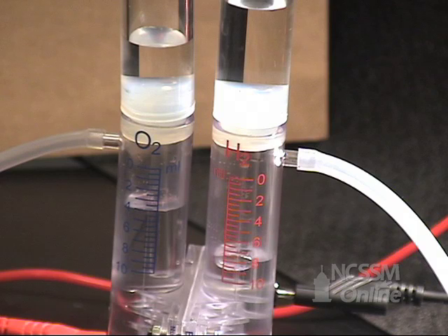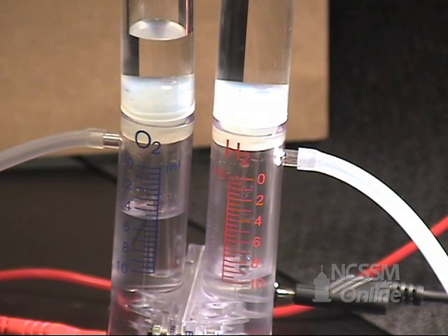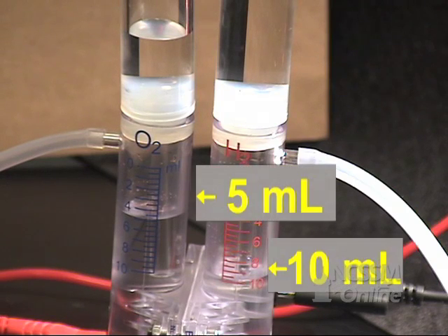Now you see the volumes are four milliliters in the oxygen side and eight milliliters on the hydrogen side. Now you see that we have ten milliliters of hydrogen and five milliliters of oxygen.